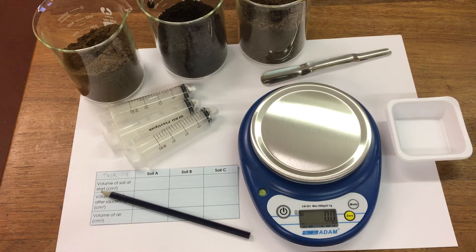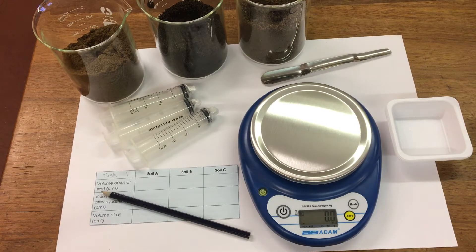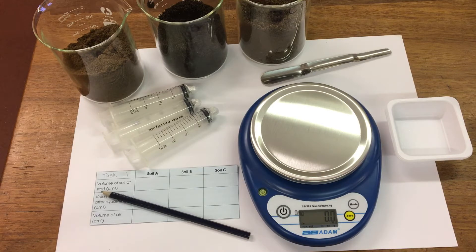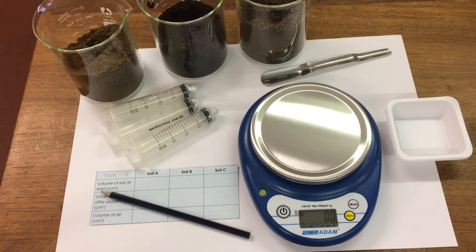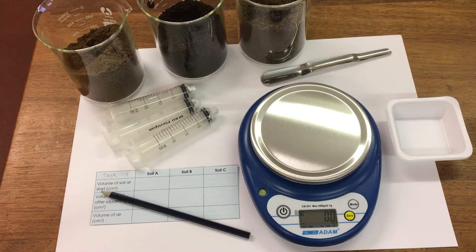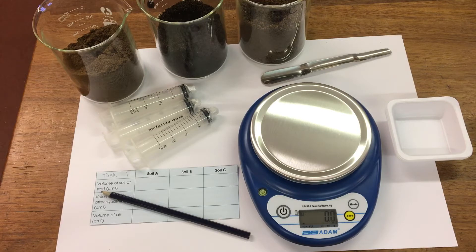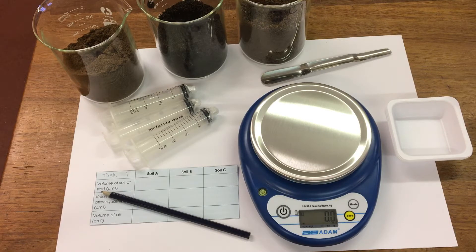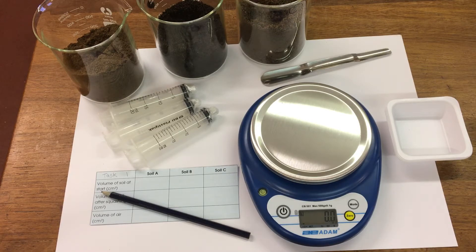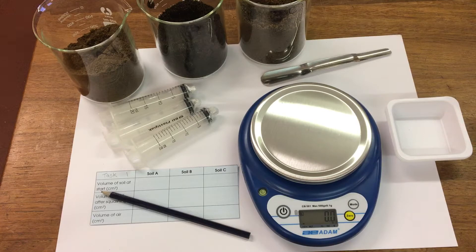In this experiment we're investigating different soil types. We're going to compare three different types of soil for water, air, sand and humus content, and then decide what types of soil are which.